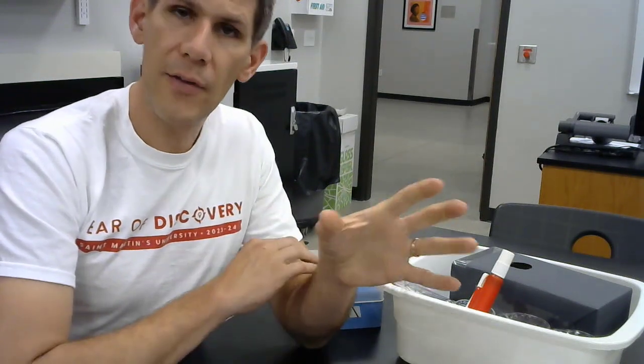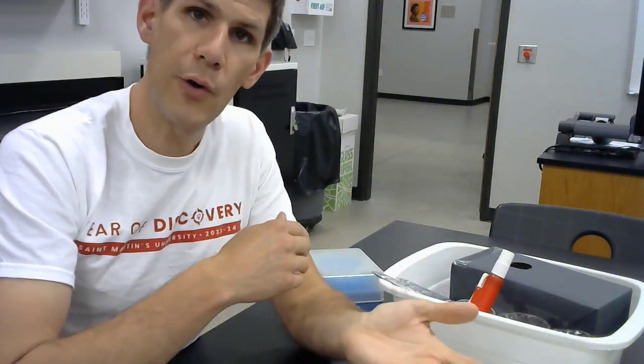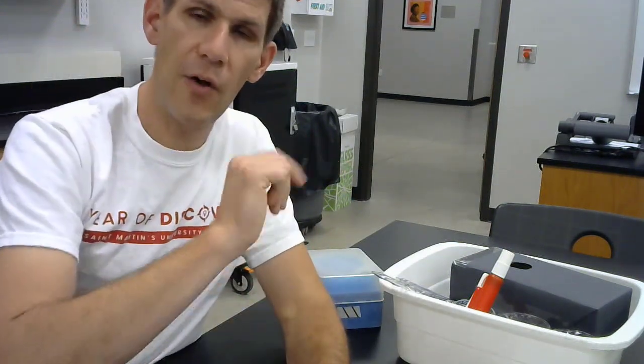We are going to measure the movement of molecules into cells indirectly by looking at how the molecules that we choose, such as urea, propanol, ethanol, and various other ones, are going to move into the cell, because as a molecule moves into the cell, this increases the concentration of solute in the cell, and water will move from where it has higher free energy, which is now the solution, into the cell. We are going to watch the cells expand as molecules move into them.